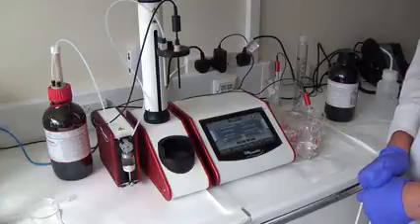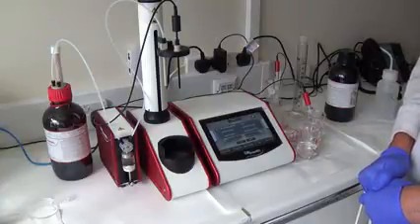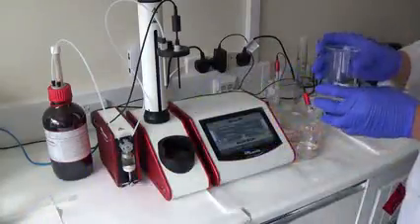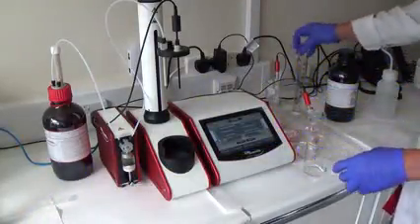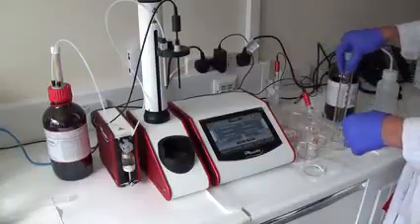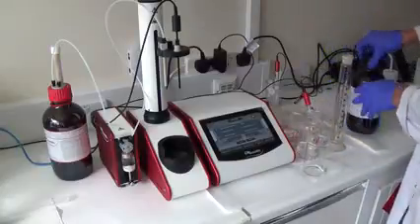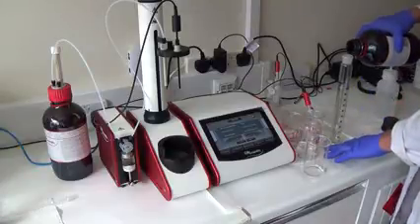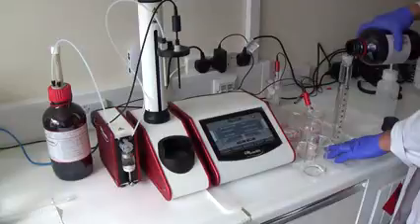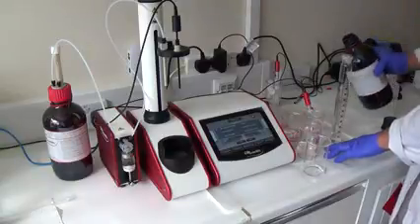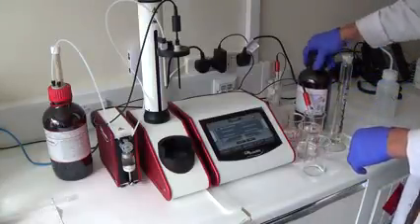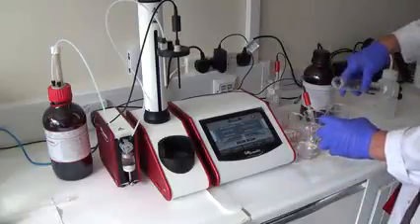I've also weighed out two grams of total acid number five standard. I put in the stirrer bar. So now I'm just going to add 80 ml of solvent, which we use for our blank. Again, this is the pre-mixed TAN solvent we used previously. So I'm going to add that to my sample.